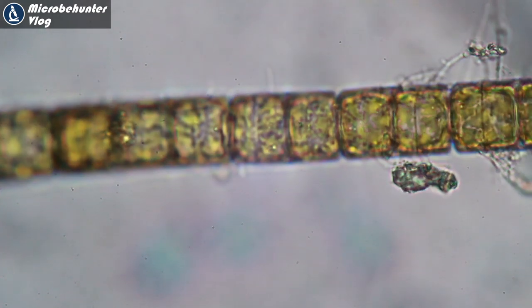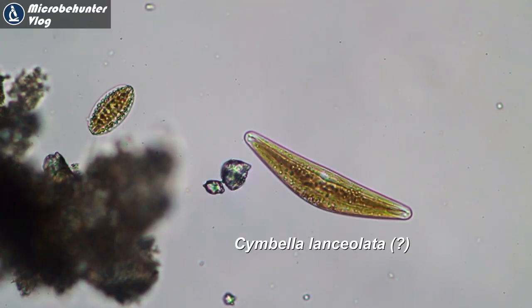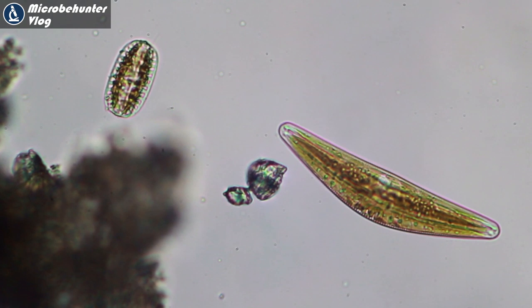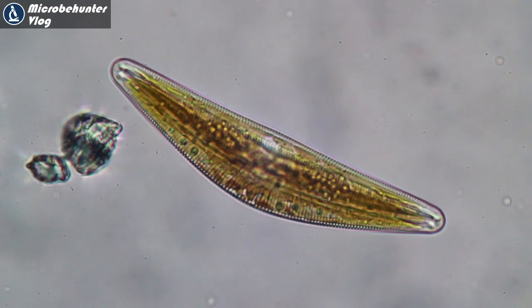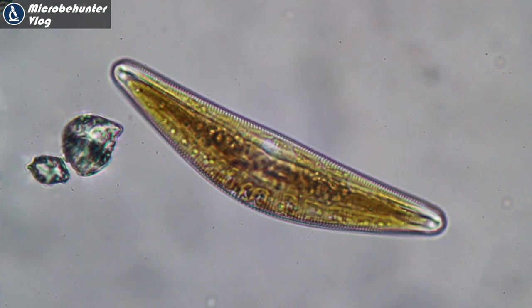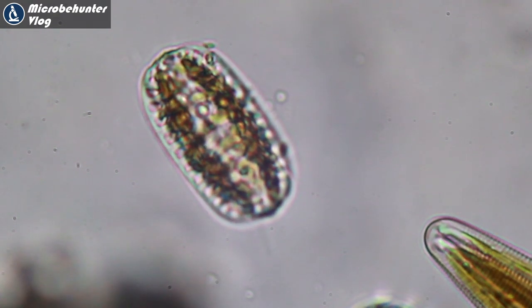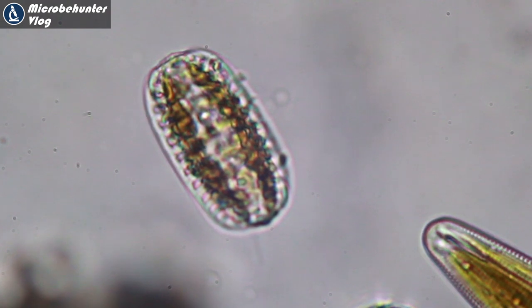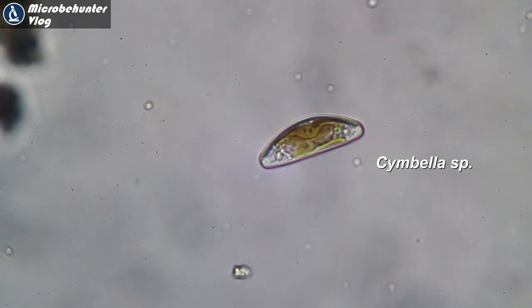However, there were also a lot of diatoms. These are photosynthesizing algae with a silica shell, giving them very interesting and varied shapes — I found a whole range of them. Zooming in further, you can see the brownish-green color of the chloroplast, showing they do photosynthesis. Many of them also move — they glide along, which is quite nice to see.